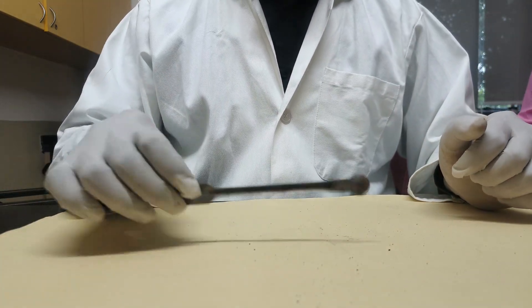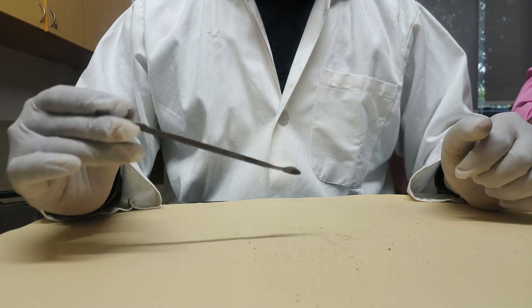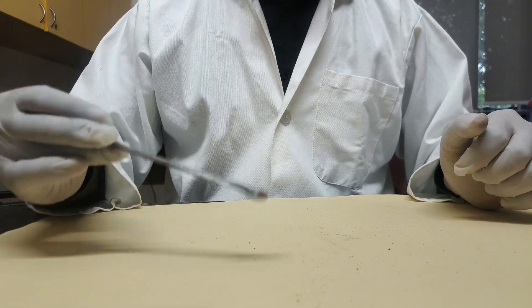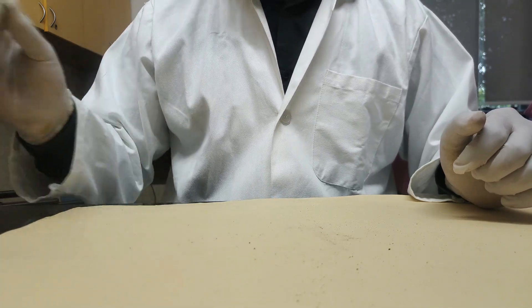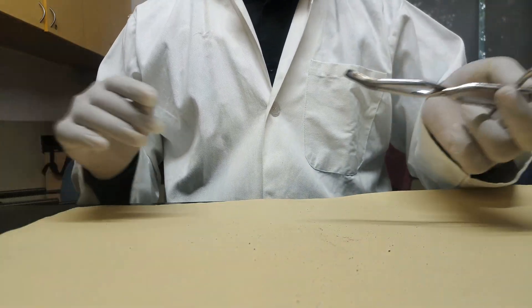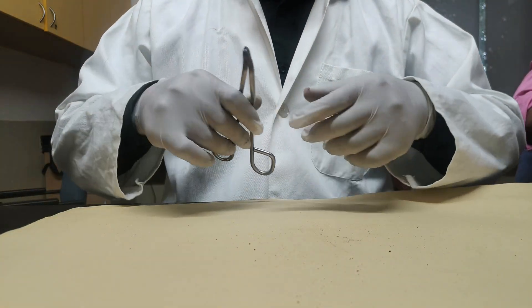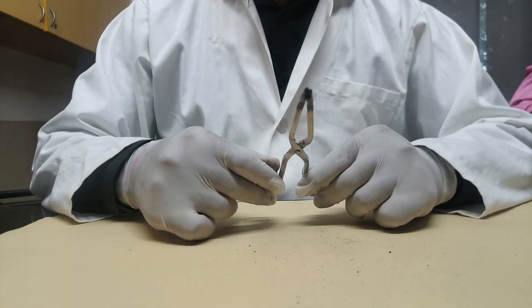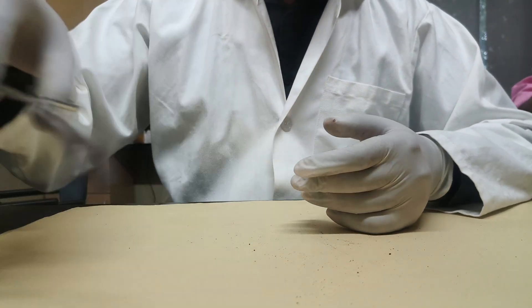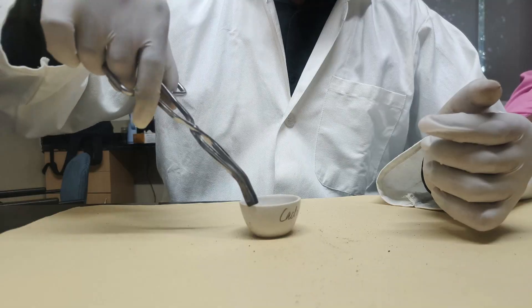Next is the spatula. It is used to take out salts from any box or container. It works like a spoon but in the lab we call it a spatula, not a spoon. Next is the tong. It is used to hold heated substances like a beaker, crucible, or china dish during the heating process.